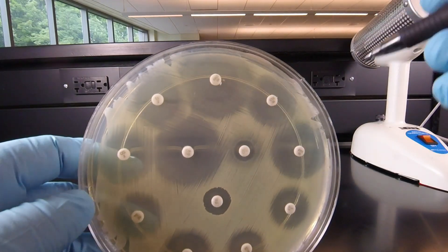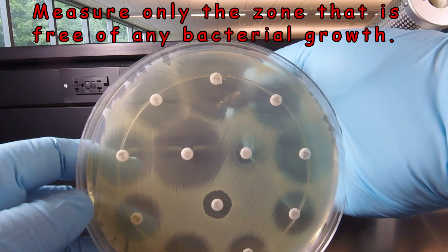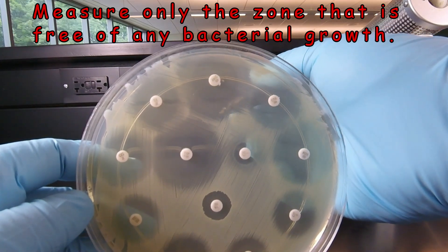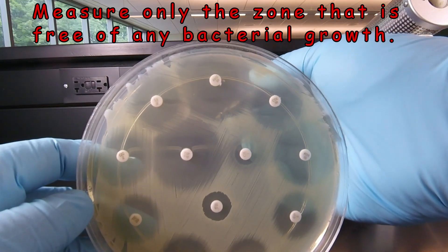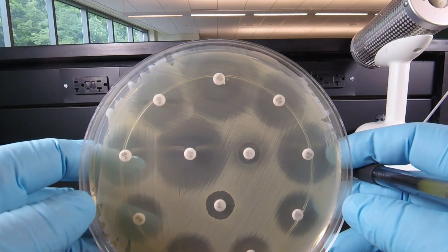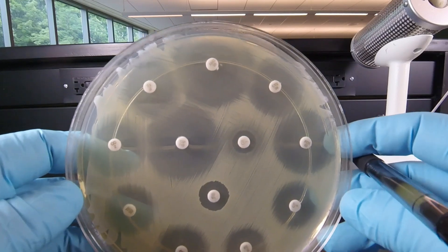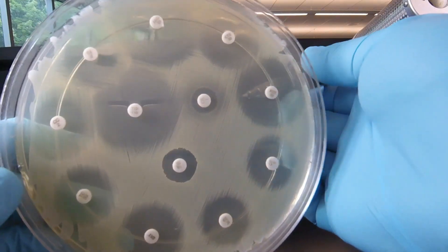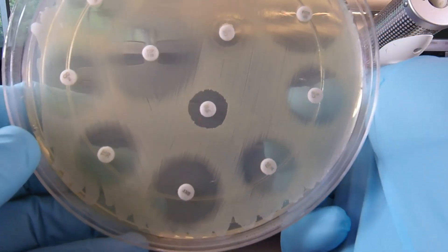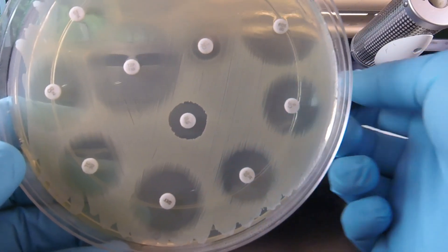In this case, we take our ruler and measure just the clear zone — the diameter of the clear zone only, not the clear and the hazy zone combined — because the bacteria growing in the hazy zone are resistant bacteria. Keep your eyes open for double zones of inhibition; it has to be totally clear to measure the diameter straight.